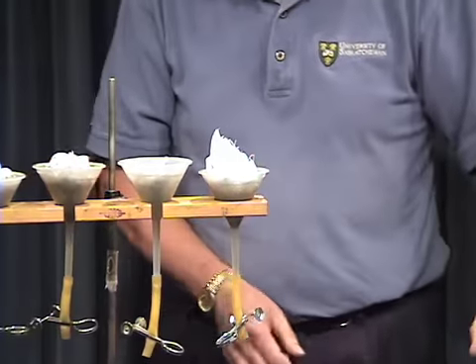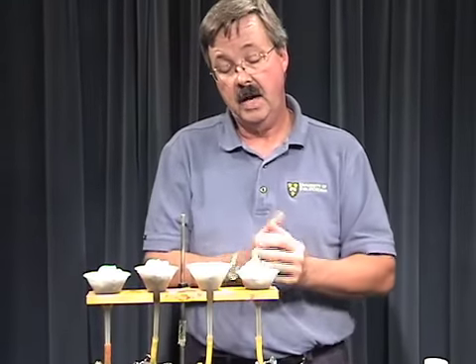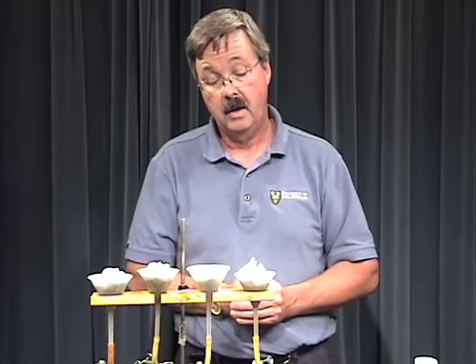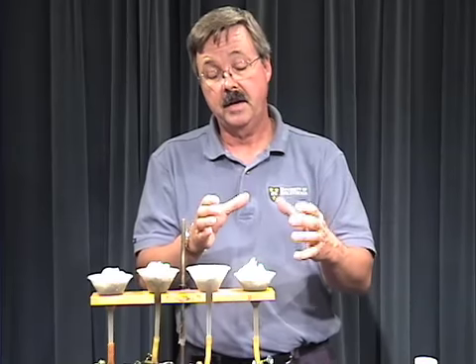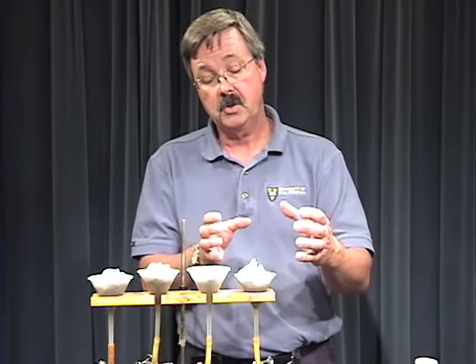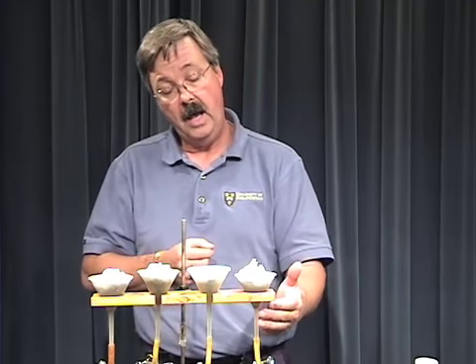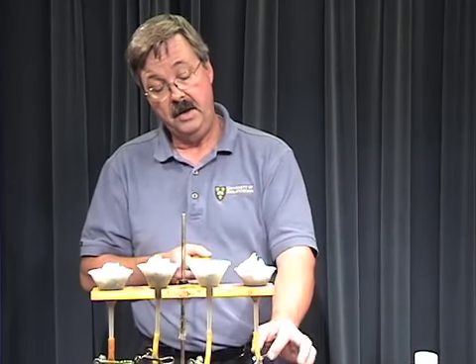And what I would normally do is I would leave this standing in water for a period of probably 24 hours, maybe 36 hours. What I'm doing is taking advantage of the fact that the system is flooded, and the active movement of these organisms in the soil will free them. They will basically float in the water and settle down by gravity into the bottom here next to this pinch clamp.